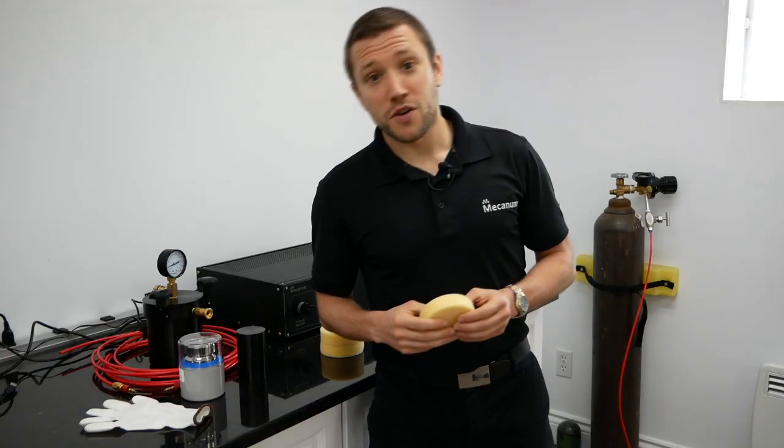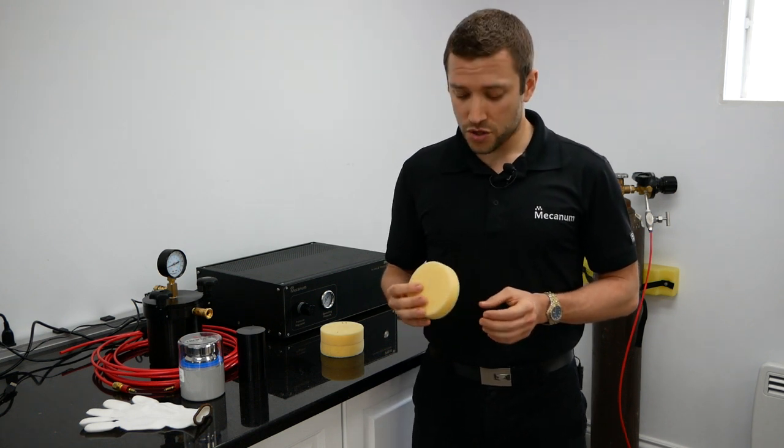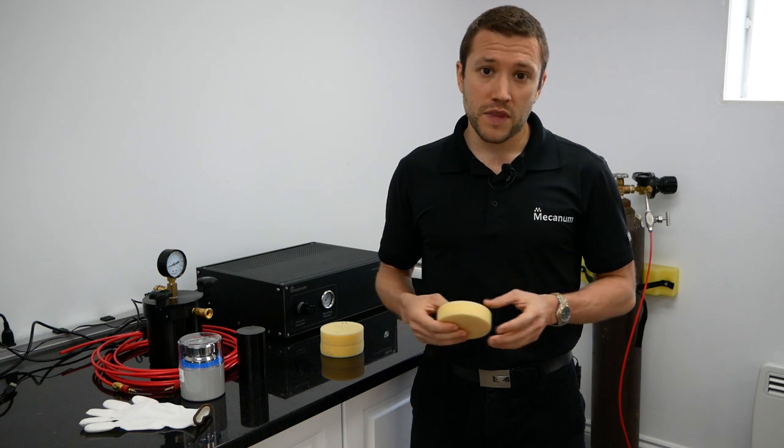As you saw in this video, the equipment is quite easy to use. It will allow you to measure open porosity and density of your acoustic material.